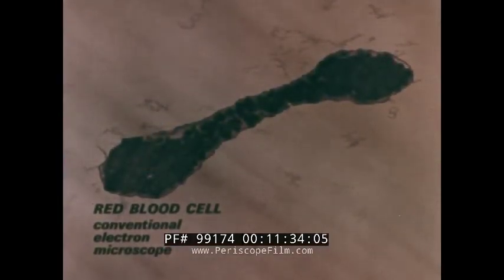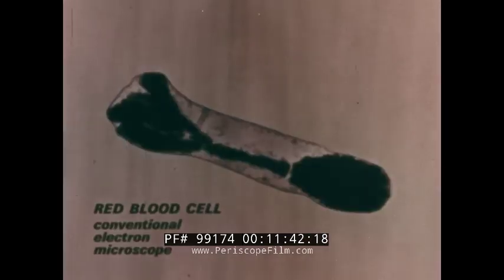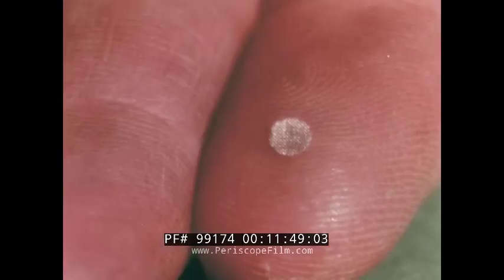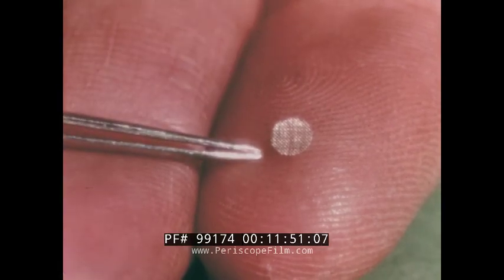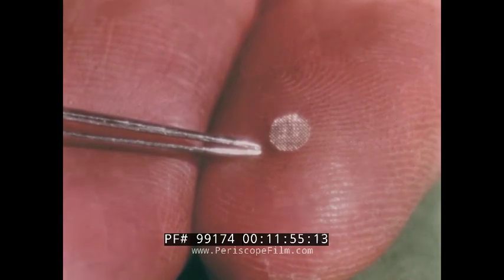Because the images produced by the conventional electron microscope are not within the mode in which we generally experience the world, a considerable amount of interpretation and technical skill is necessary in order to extract useful information from them. Here, for example, is a wire mesh, 200 square holes to the inch, photographed through the conventional electron microscope. It looks like no more than a flat shadow.